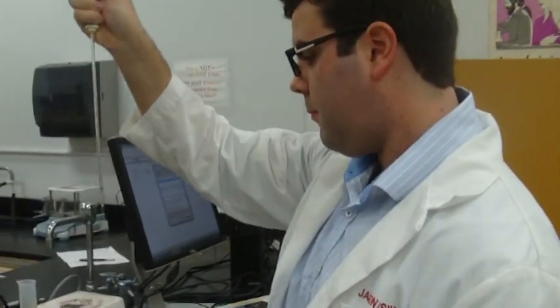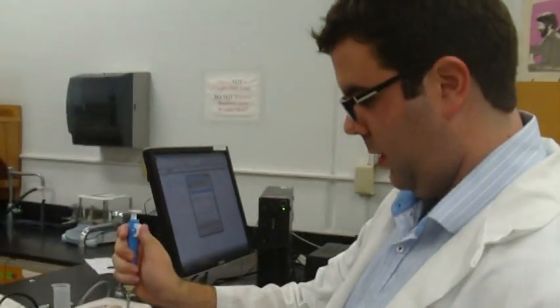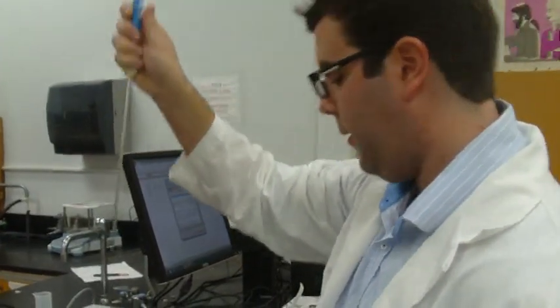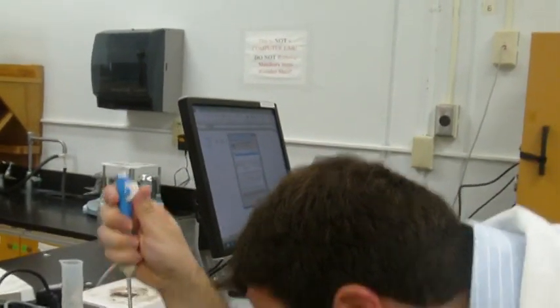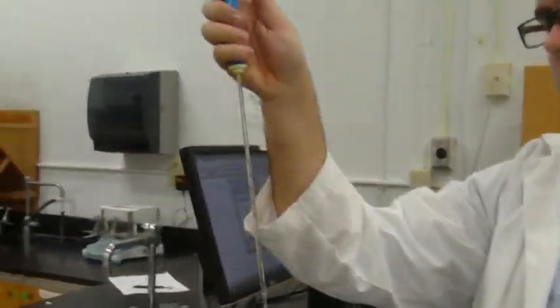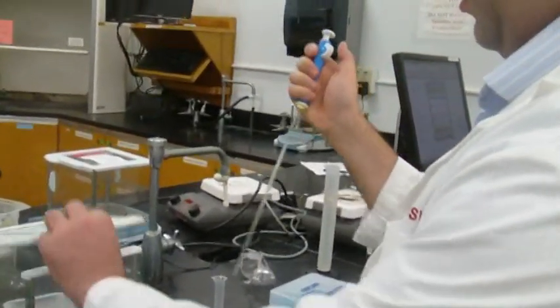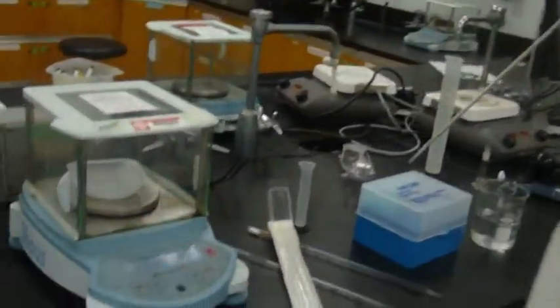Is it important to pull it out of the water when you get your final value? If you leave it in the water, then the water pressure will kind of push up the water in the pipette, and the meniscus will be a little bit higher. So when you are actually finding the final volume, sometimes you can go a little above it and then expel it out while you're outside of the water. Got it. All right. So like we did before, we're just going to tare that to get 0 and pour in all of that.